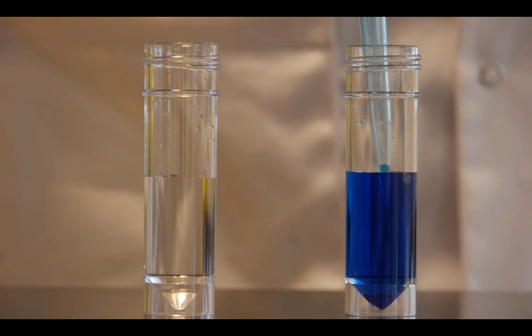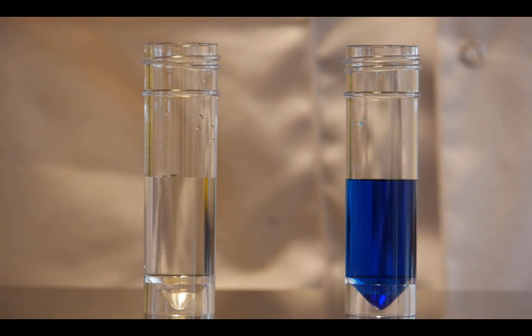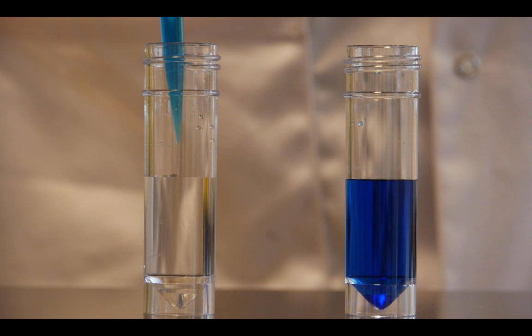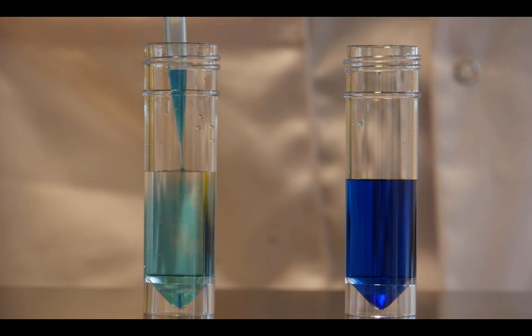Here we can see the liquid being taken up into the pipette tip, transferred over, plunger is pushed down to the first stop, brief pause and then push through.